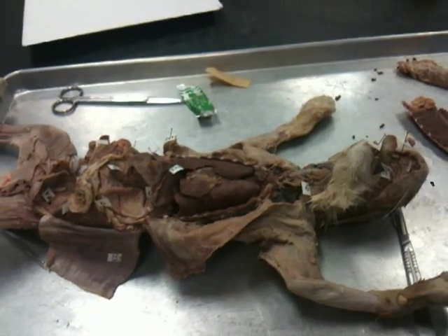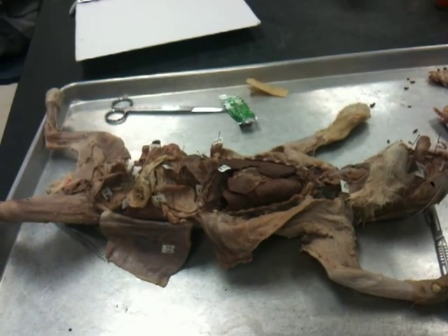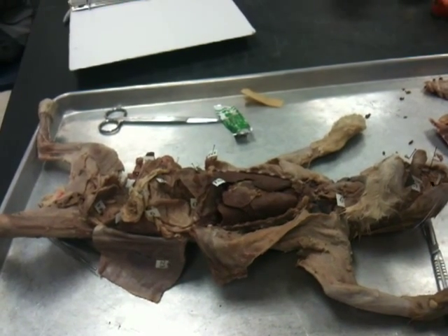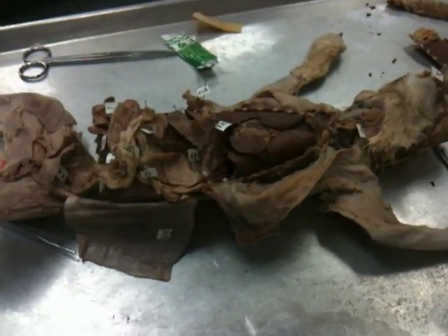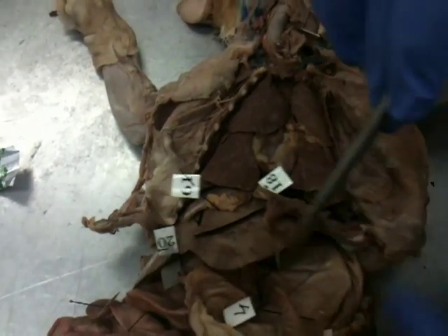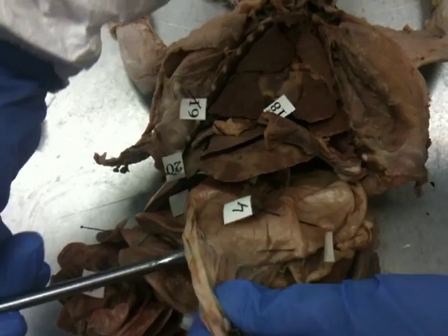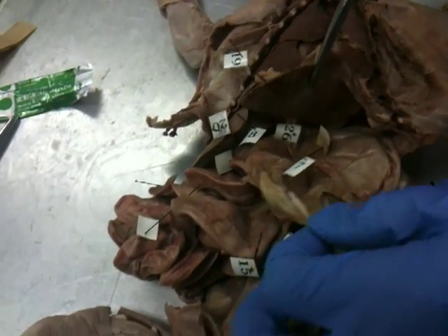So this has a cut jaw. Do you want me to remove the old tape on the outside of the bag? If it comes off easily, but sometimes it just rips the bag. So just make sure that one's on the number. Seven is the stomach, this area.